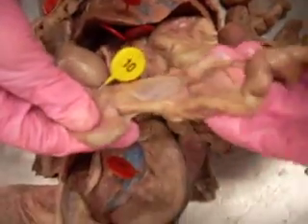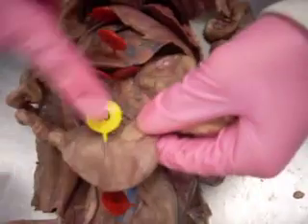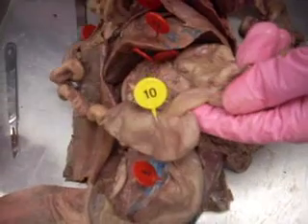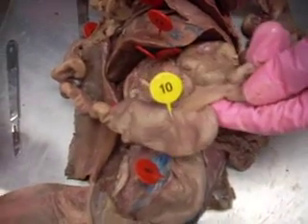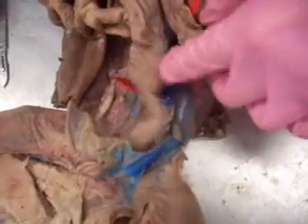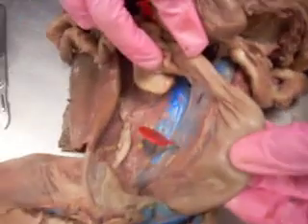This is where the small intestine, this part of the ileum, becomes the large intestine, number 10. The initial segment is known as the cecum. The valve that things pass through from the ileum to the cecum is known as the ileocecal valve. That is the ascending colon — not in its proper place, it would be about here. The transverse colon wraps around, and then the descending colon goes down. Number 5 is actually the mesocolon, and it goes down into the rectum and anus.